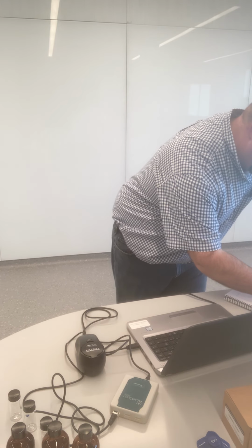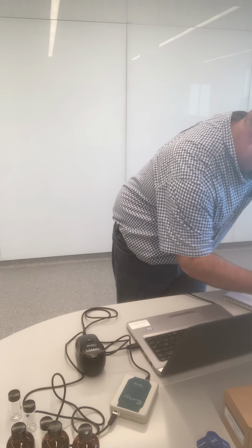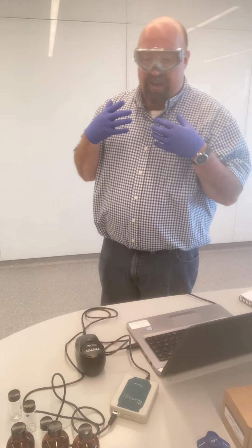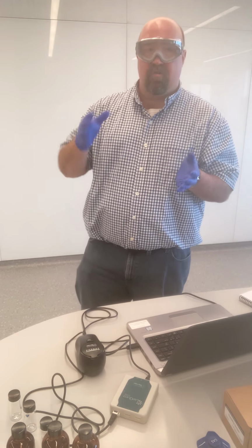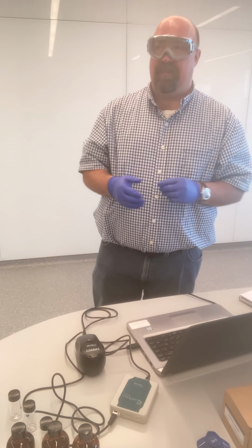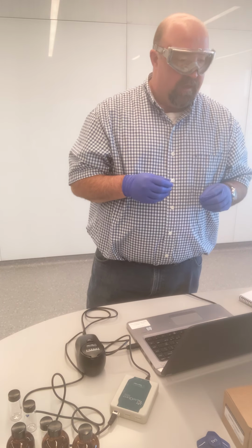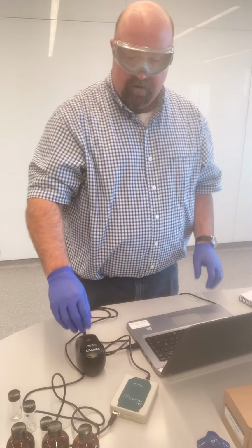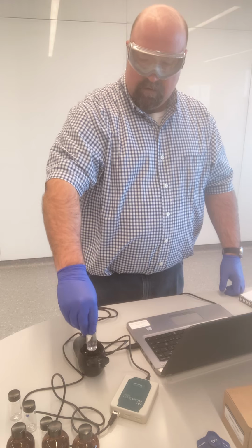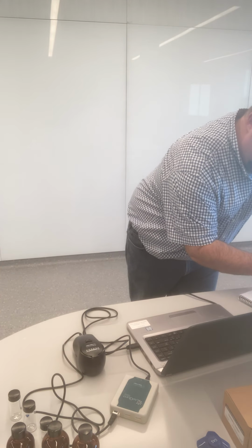So my initial reading for sample spot 1, 9.6 NTUs. Now, as discussed in pre-lab, we always want to take replicate measurements whenever we can. We never just take one measurement and call it good. We want to make sure that our data is reproducible and that we can get good, precise data sets. The way we are going to do that with our turbidity meter, our turbidity sensor, is I'm literally now just going to take the sample out. I'm going to put it back in, and I'm going to get another reading.